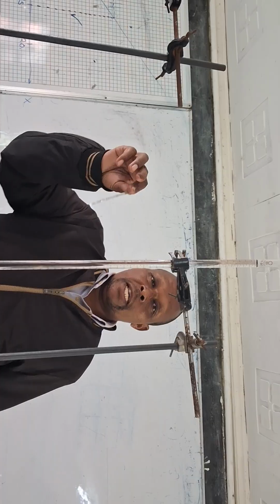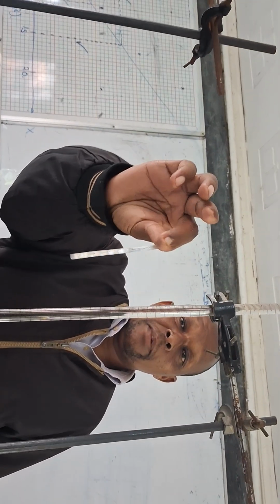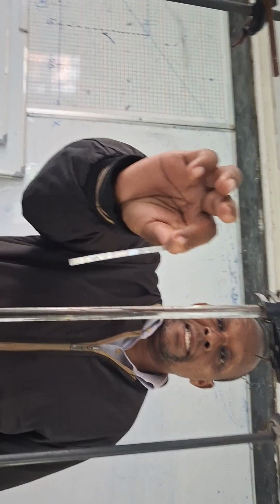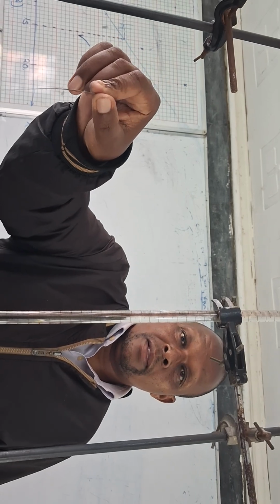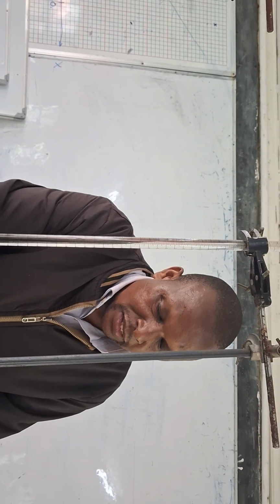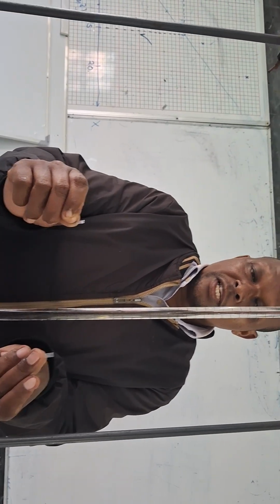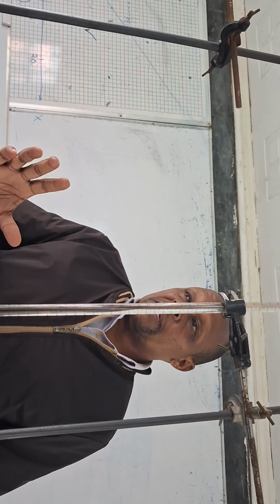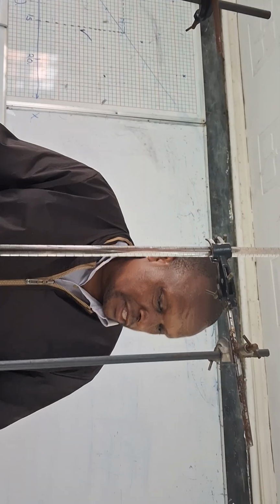So as per the procedure, you have the magnesium ribbon. This magnesium ribbon has been cleaned, the coating of magnesium oxide has been removed by scrubbing until it becomes shiny. We have already cut 2 pieces of the ribbon. These are the ones we are going to use for the experiment. We are going to perform only 2 experiments. We have data values that we are going to use for the remaining part of the experiment.